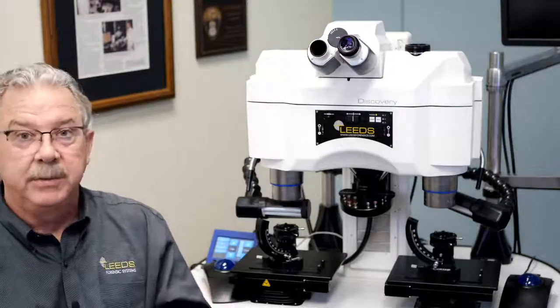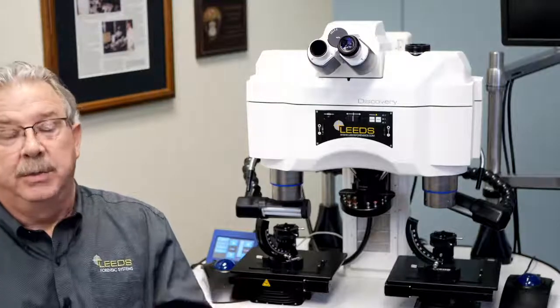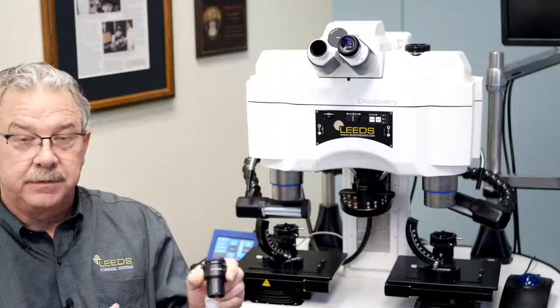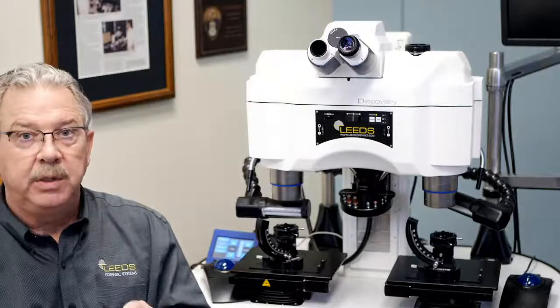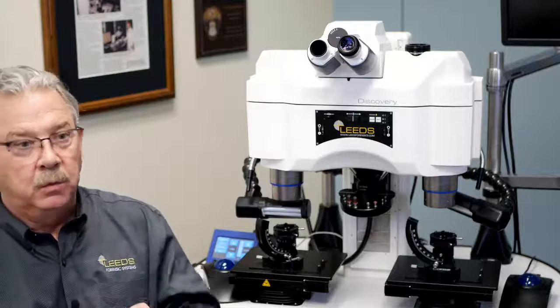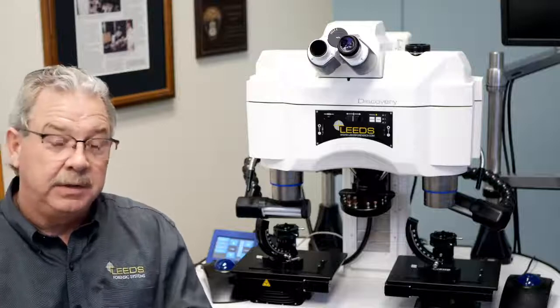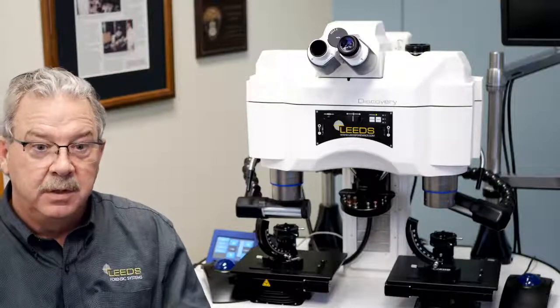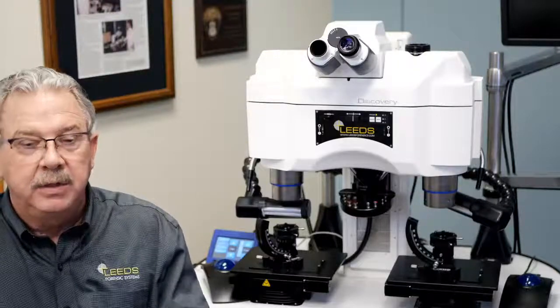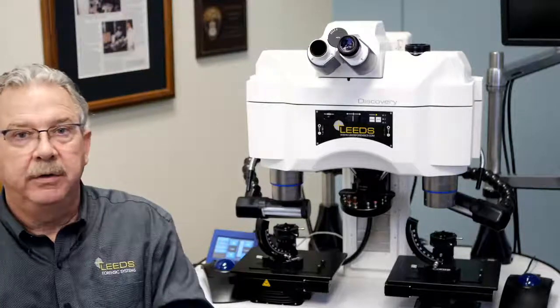With a 20 millimeter, I'm going to see a 20 millimeter field of view. With a 22, I'm going to see a 22 millimeter field of view. And finally, one of the exclusives with Zeiss is they've got a 23 millimeter field of view. Why does that matter to me? Well, we'll take a look at some areas in a minute, but what it means is that with an 18 millimeter field of view eyepiece, to see the same total area of my sample, I'm going to have to take more steps, more fields of view to cover that whole area.